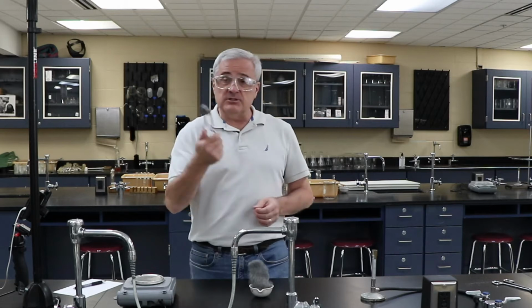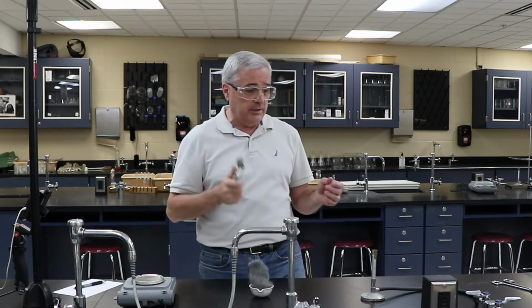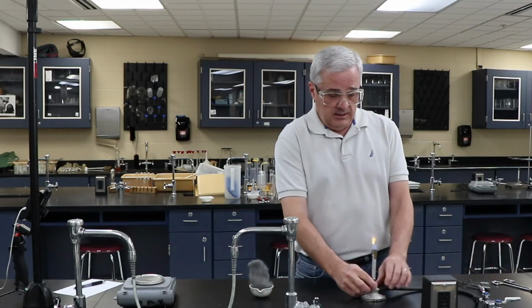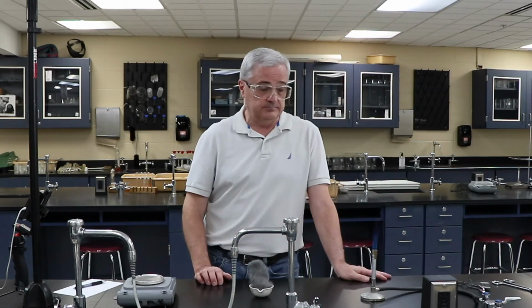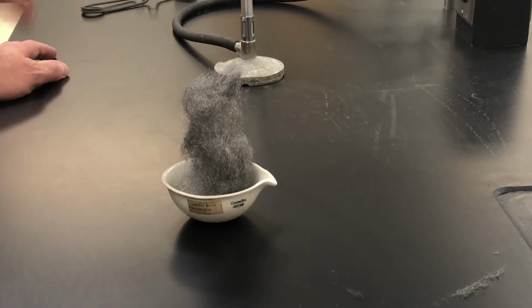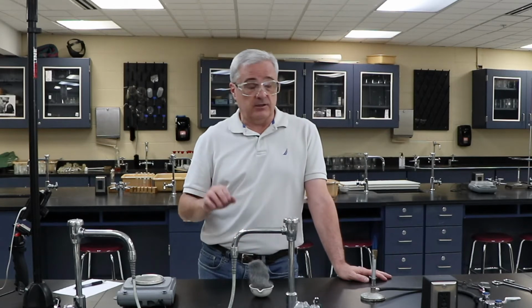Procedure-wise, we're going to light the Bunsen burner using one of these things that you can buy at a hardware store or on Amazon. They're basically welding lighters. The kids in my class love to play with these things and want to know where you can get them. I'm going to light the Bunsen burner, which we're going to use simply to ignite the steel wool. I'll just stick it in there, and it's going to ignite the steel wool. The steel wool is going to burn down. So I'm going to conduct that, and then we'll collect the results afterwards.